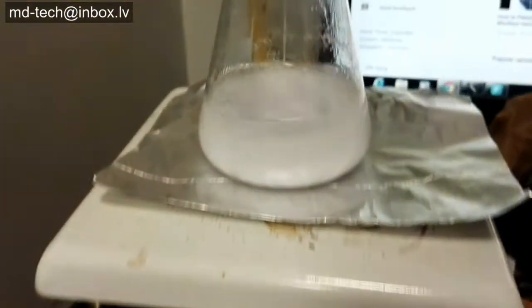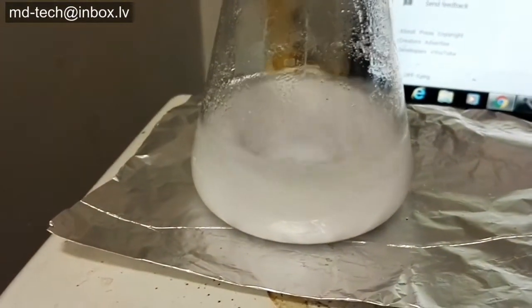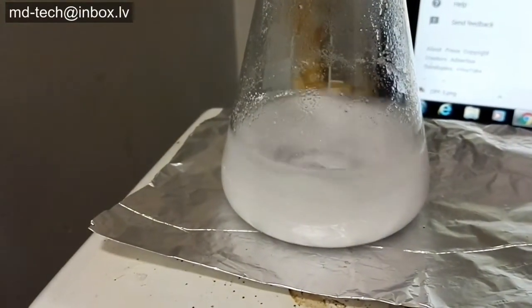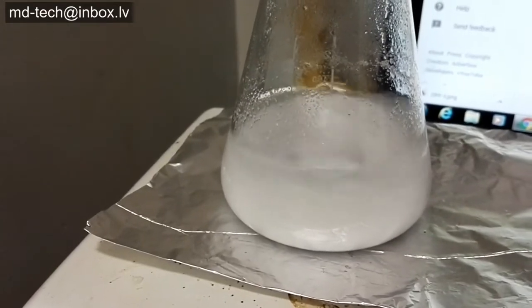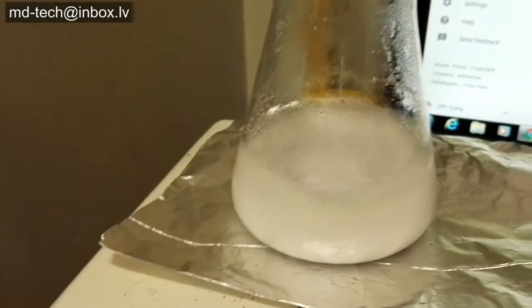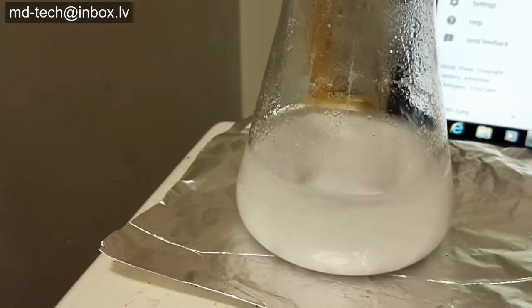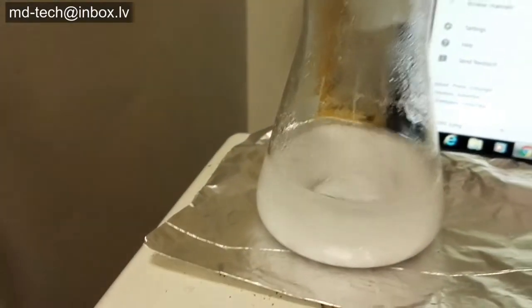Now need to dissolve all silver chloride in ammonium hydroxide solution. After you dissolve all silver chloride in ammonia, you need to understand: do not hold this liquid for a long time. Maximum one day, and do not place in direct sun. After some time, black silver nitride crystals form — it is explosive.